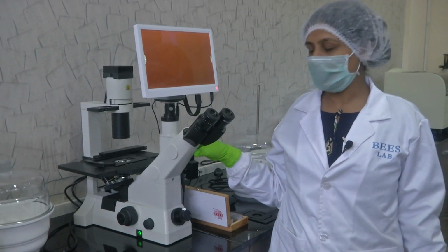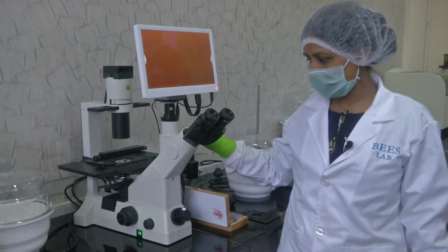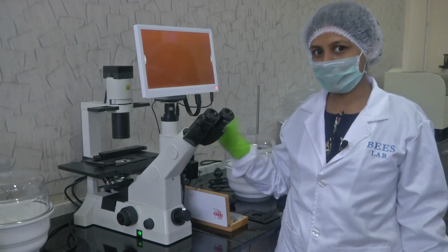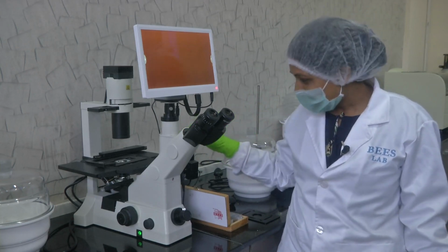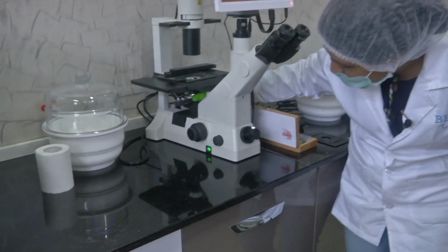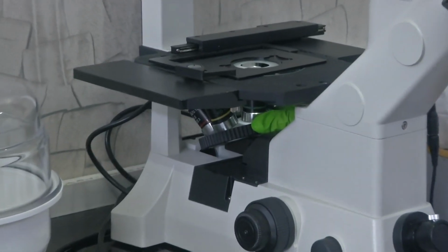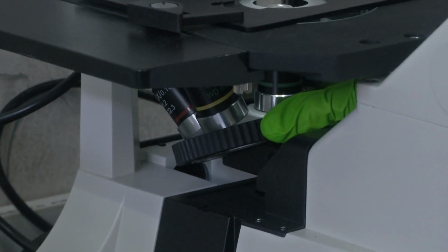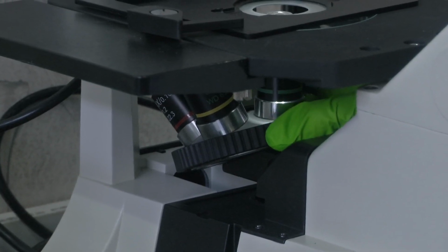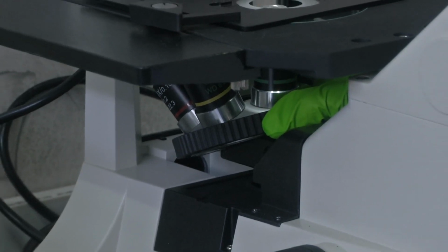Why is it an inverted microscope? A major difference, you could even call it a unique feature of this microscope when compared to the stereo and metallurgical microscope, is that the turret or the rotating nose piece is here down below. Unlike the stereo and metallurgical microscope where the turret was on top and the light source at the bottom, here the turret which is holding the objective lens is at the bottom.